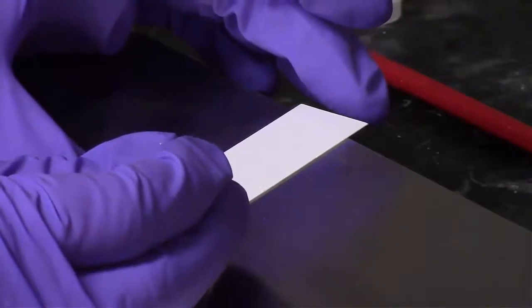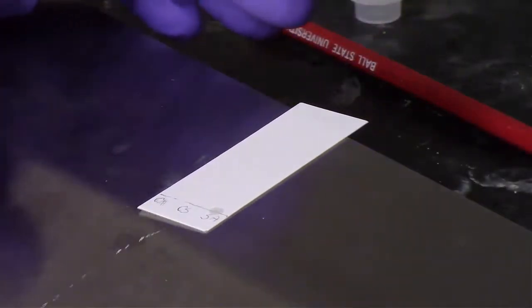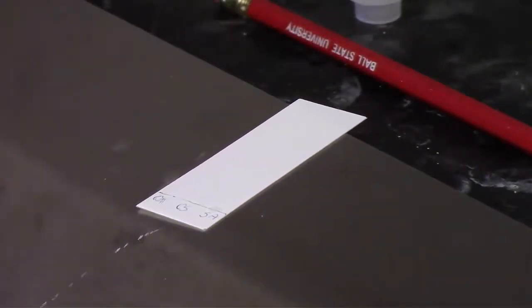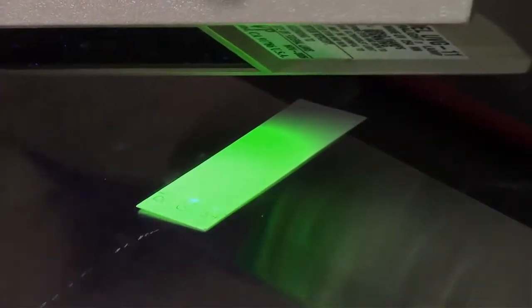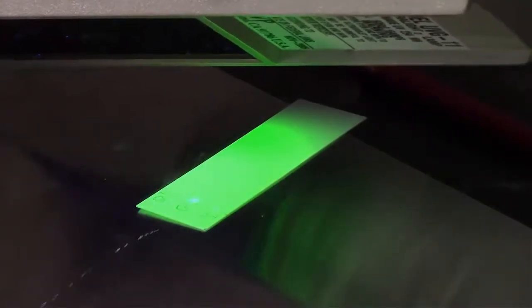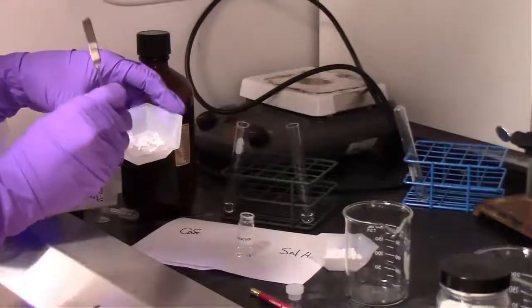So now we're getting some of the salicylic acid and spotting that. So we'll look at this under UV light and see if we can see the spots. Okay, so it looks like you can see the mixture of 2 compounds pretty well. You can see that spot, but you can't really see the caffeine or the salicylic acid spot. So both of those need to be respotted, because if you can't see it at the baseline, you're not going to be able to see it once it runs up the plate either.